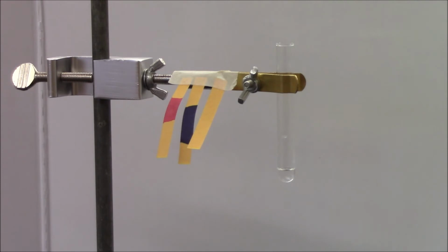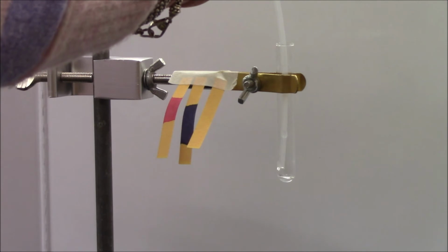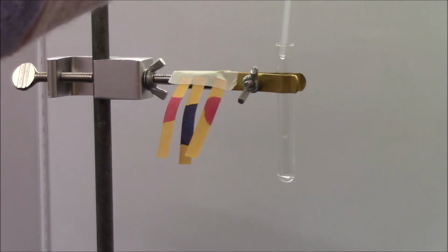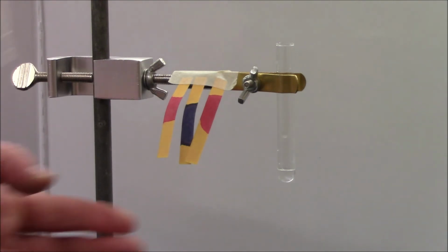Now, if you didn't notice, when I added the sodium hydroxide to the hydrochloric acid, there was no visible reaction. However, when these two substances mix, we make water. And water is neutral. Water also drives a double replacement reaction to happen. I did not add an equal amount. Bummer. Which is why that is still pink. What I was hoping to do was add exactly the same amount of each so that when it mixed, it became neutral and you could see a different color on the pH paper. Unfortunately, I didn't add an equal amount of each. I want to see something here.